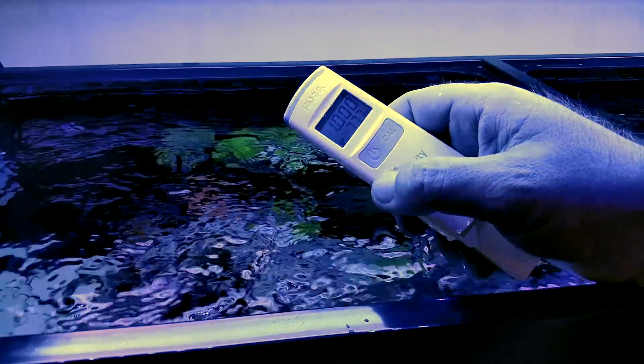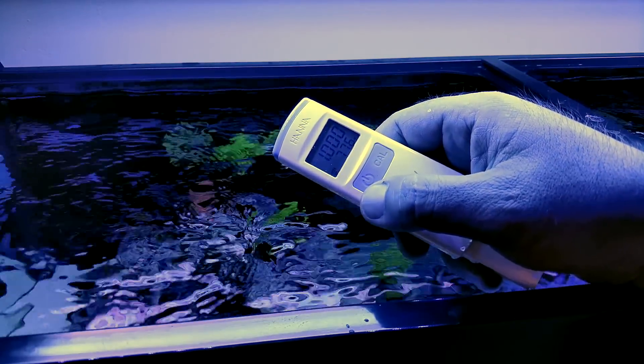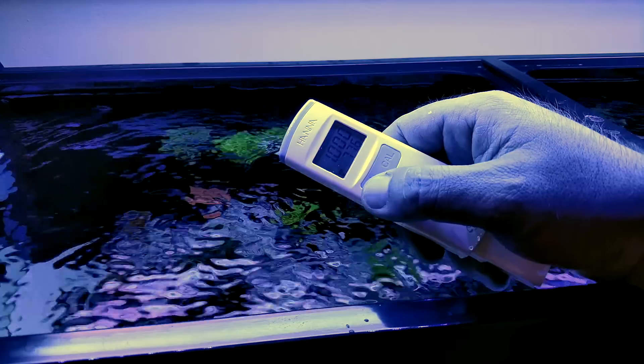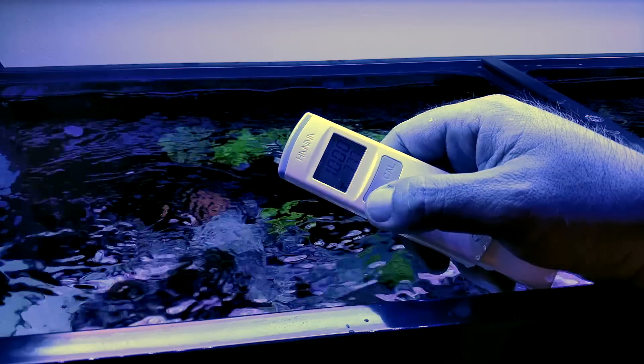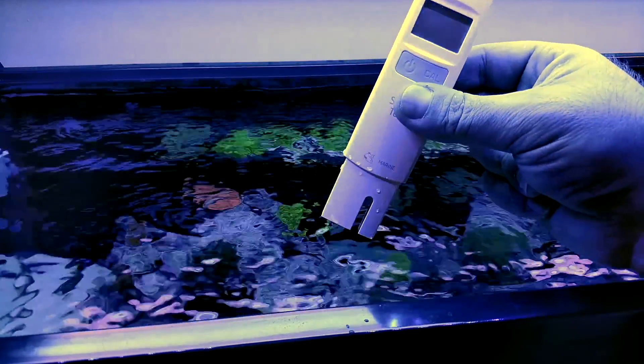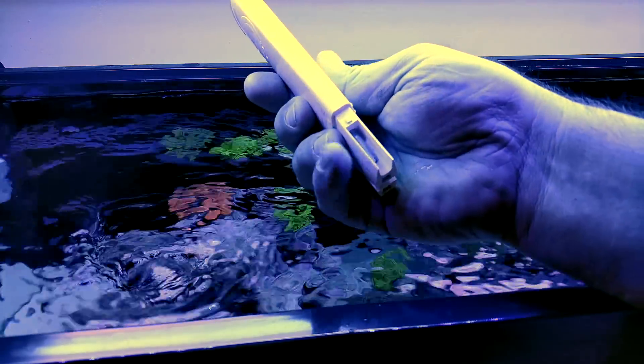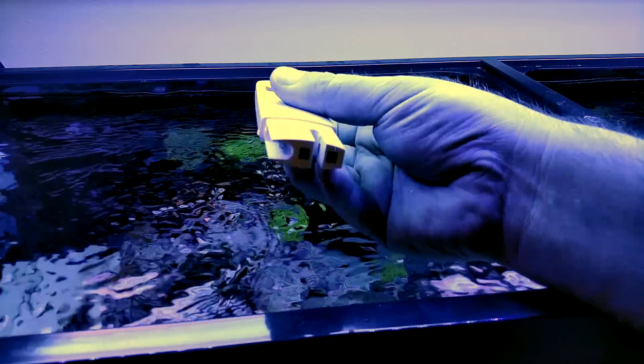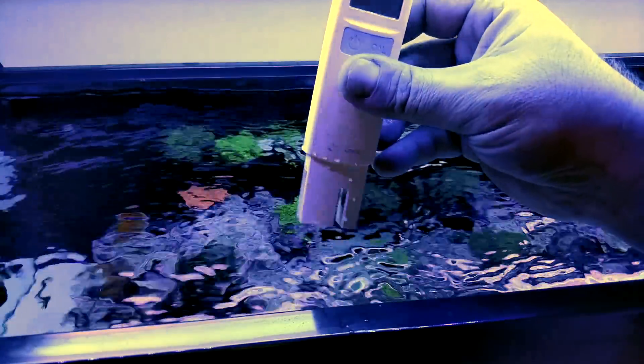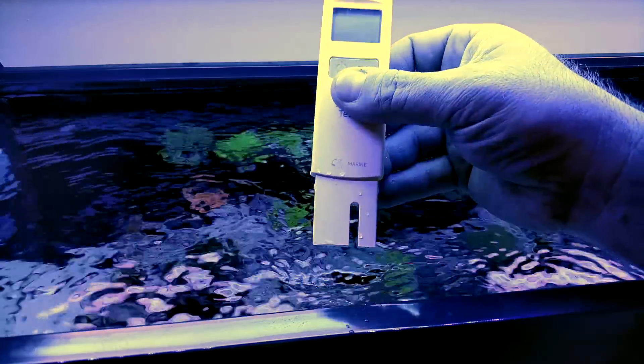Now it does have a fail safe so that if you leave it on, I believe it shuts off automatically, but I don't remember 100%. Check the Snowman's video. Maybe he says it in there. Now when you're done, I have a little cup of RO water that I dip this in. It does recommend that you rinse it off to get the electrodes or diodes, whatever's inside of this device, clean them off, get the salt water off, let it air dry overnight, and then put the cap back on it and store it.